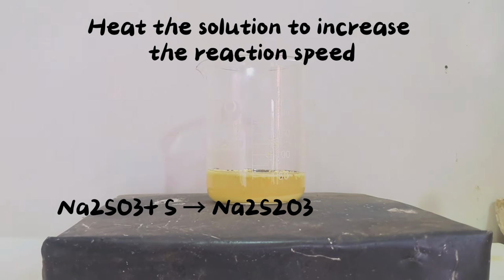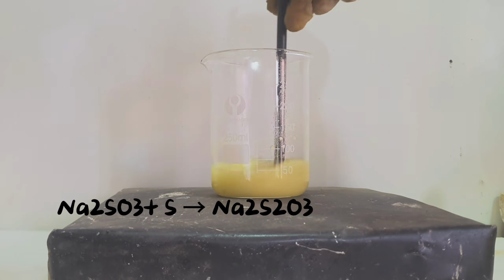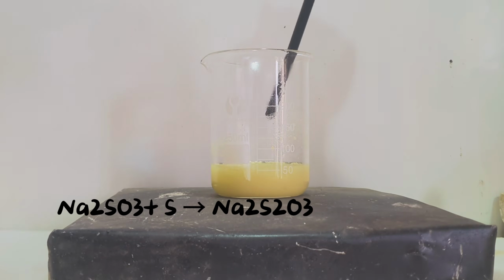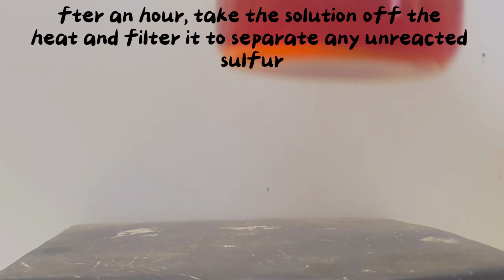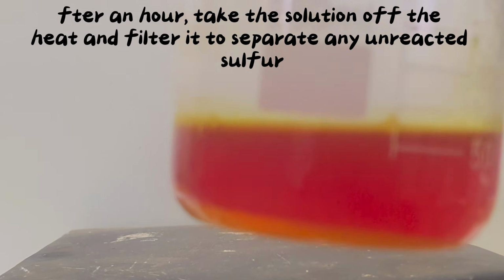Heat the solution to increase the reaction speed. One hour later. After an hour, take the solution off the heat and filter it to separate any unreacted sulfur.